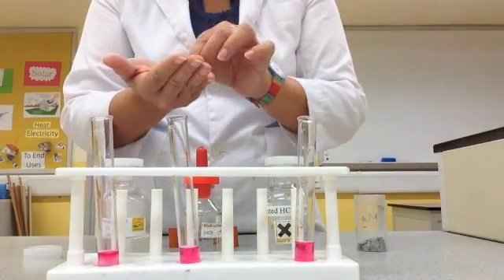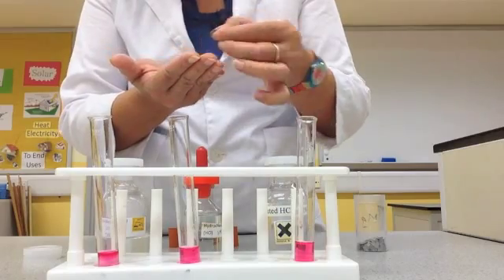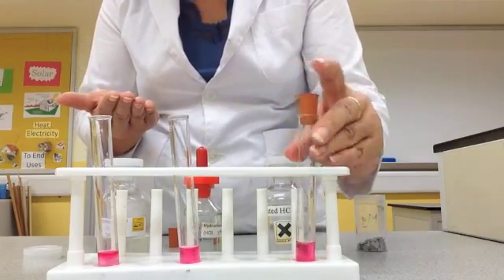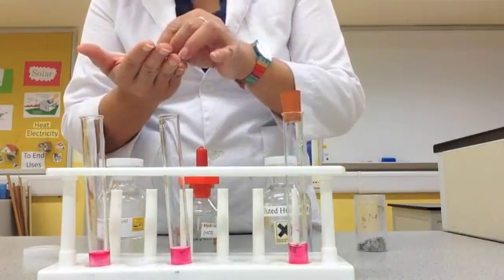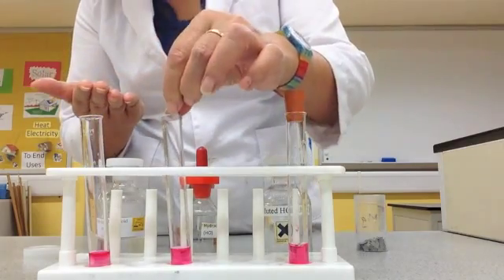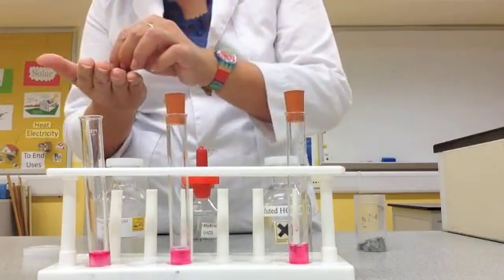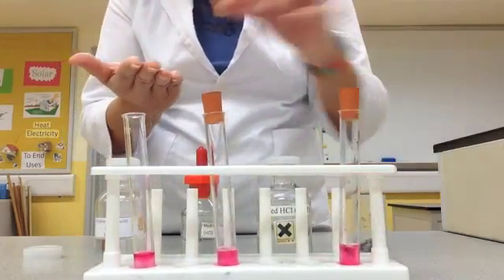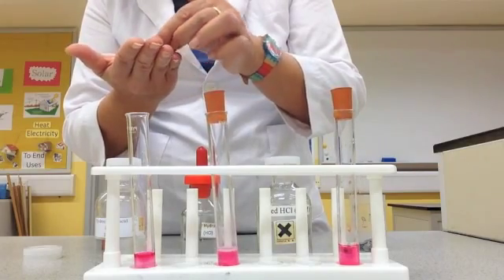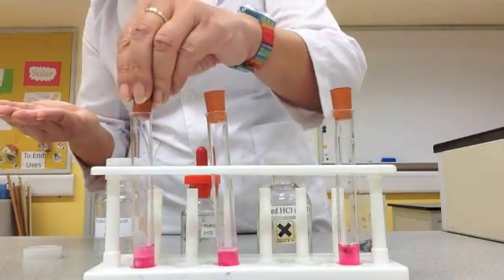Let's put some in the 0.1 — I'm going to put three strips in 0.1 and cap it. I'm going to put the same three strips in 1 mole and cap it, and I'm going to put the same amount — three strips — in the 2 mole. Now watch what happens.